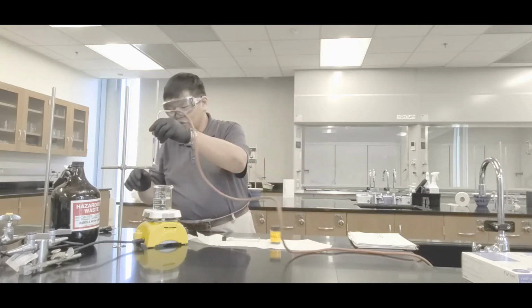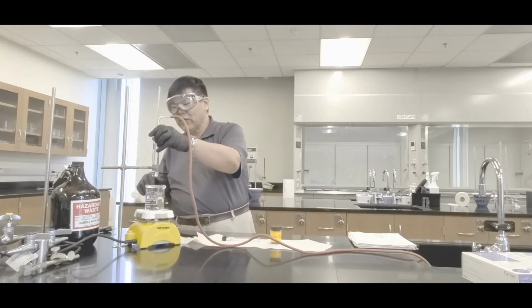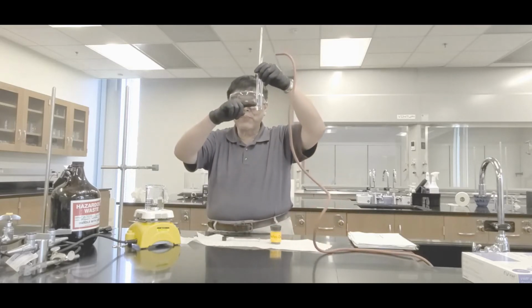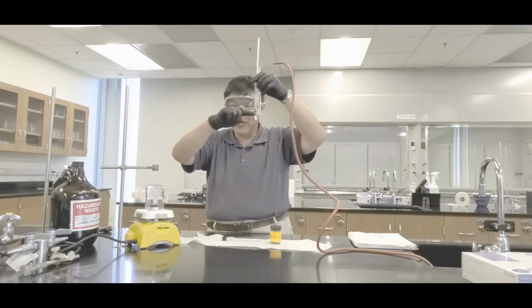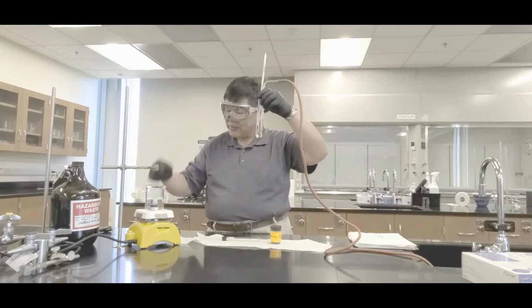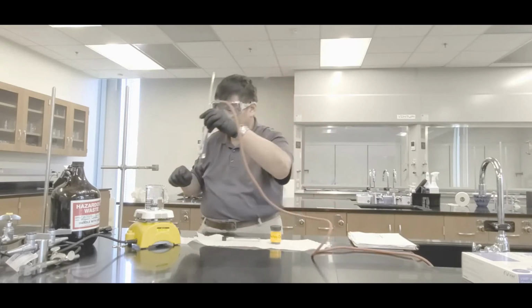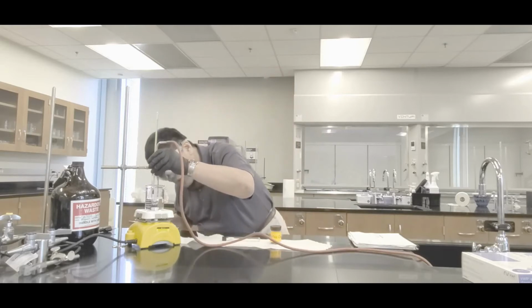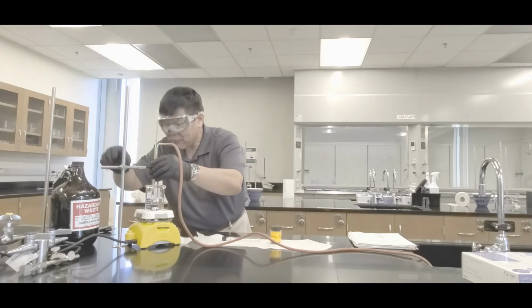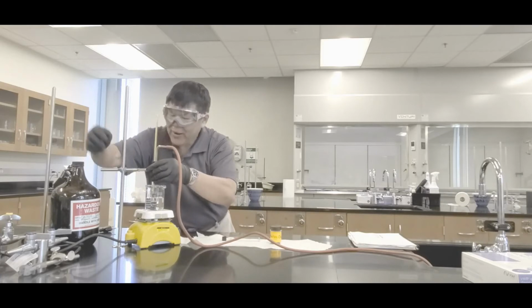Next thing, mount it onto the clamp. Now, here's the thing. You want to lower it such that the water level is higher than the liquid but below the thermometer, okay? Let me repeat. The one in the book, I messed up a bit. I drew it in the wrong manner. The water level should be higher than the liquid but below the thermometer. So in that case, here we go. Like that. Clamp that on. And in my case, I have to lower it just a tad bit. There we go. Okay? All right.